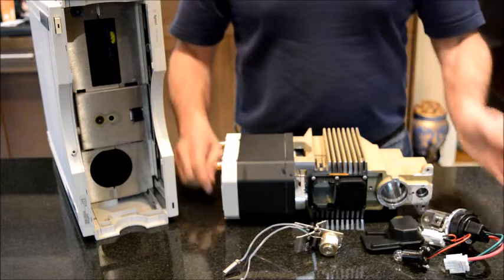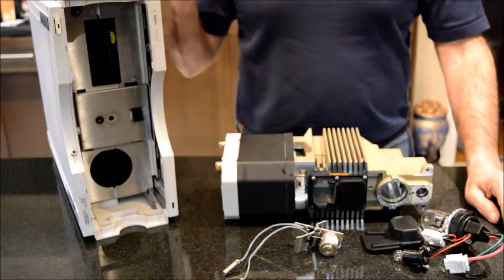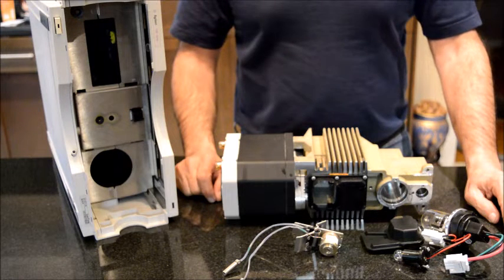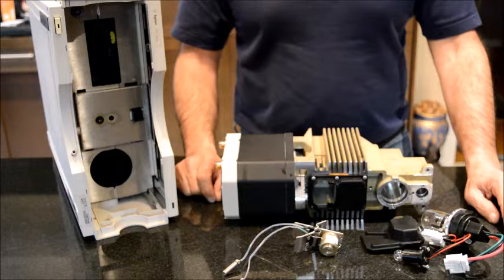The rest of this detector consists of the motherboards and electronics. They sometimes may have problems, but not too often.